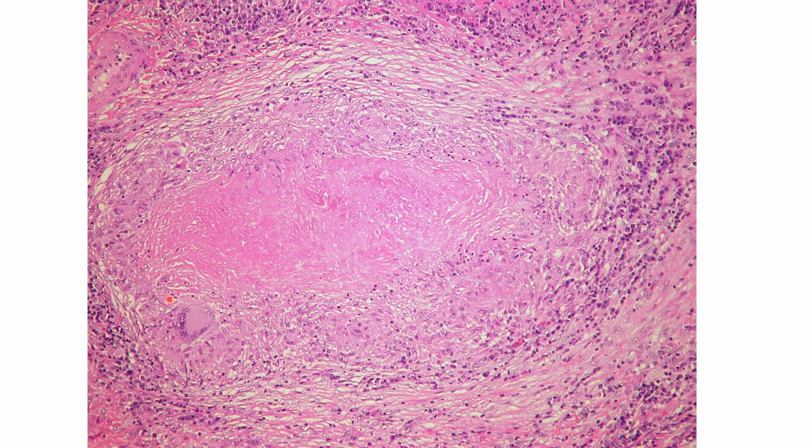One of the most peculiar things about granulomatous inflammation is the presence of these cells, which are composed of histiocytes that collect together, and have a very distinct arrangement of the nucleus, almost like a half moon shape, and this is what we call giant cells.